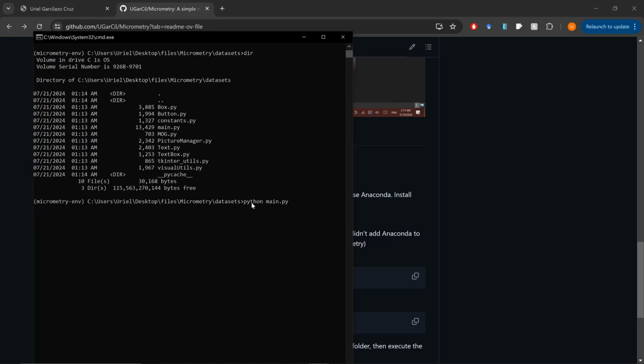In the previous tutorial, we discussed how to access your webcam. Now, the flag for this is camera index. Here we can use a number where the default is 0. So if you don't specify anything and you just try to run the program, that is the index that it's going to use. However, if I try to run it as is with the index 0, I'm going to get an error. And the reason why is because I'm currently using that webcam to record this video. So I need to access my other webcams, and I can do it with other numbers.